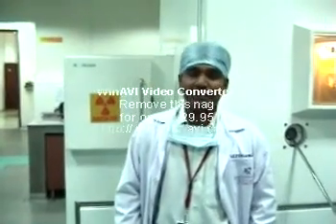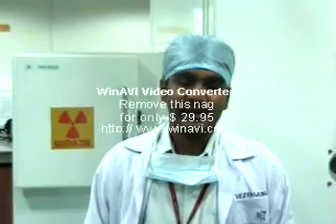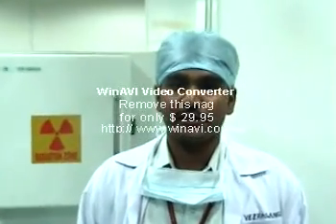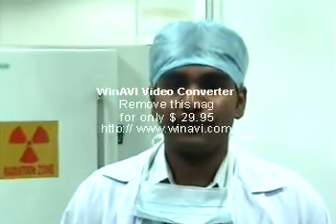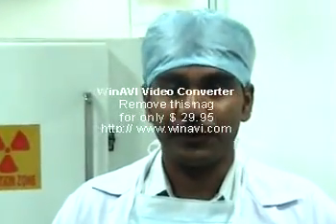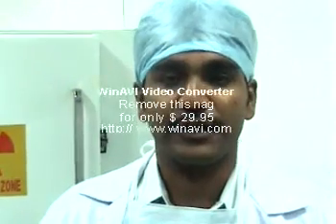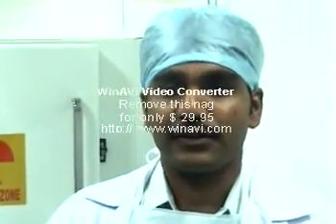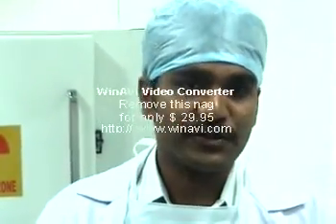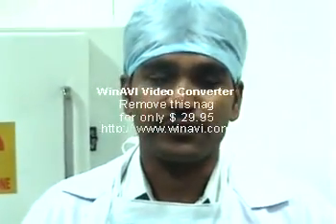Welcome back. As I mentioned earlier, right now we are producing three radiopharmaceuticals: one is F-18 fluorodeoxyglucose, two is F-18 sodium fluoride for bone scans, and three is N-13 ammonia for myocardial perfusion scans. Today I would like to present how we synthesize fluorodeoxyglucose.